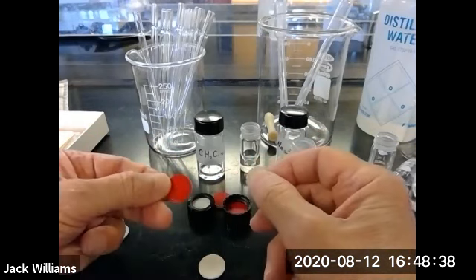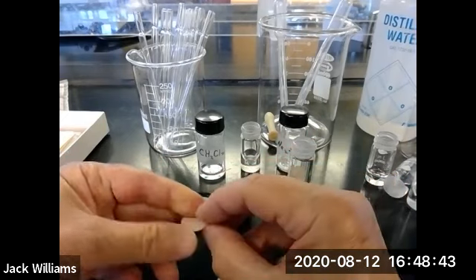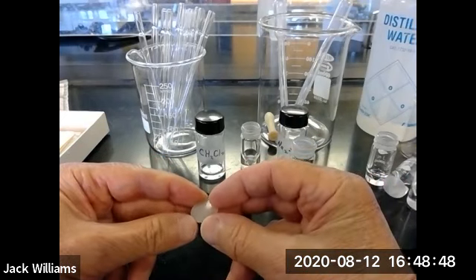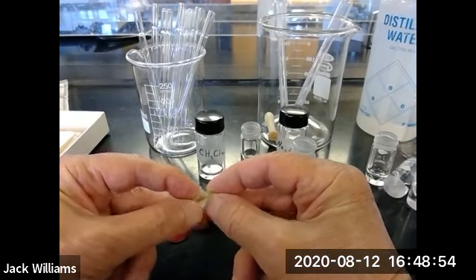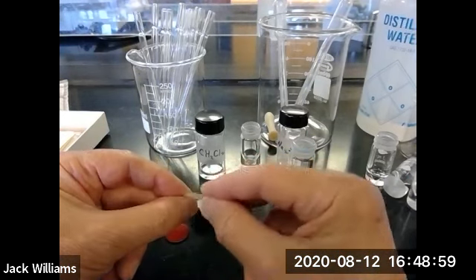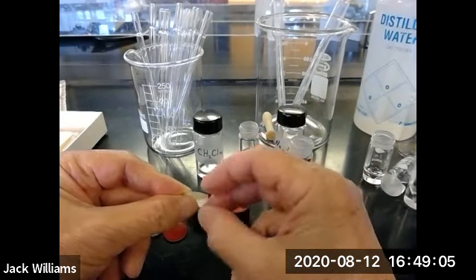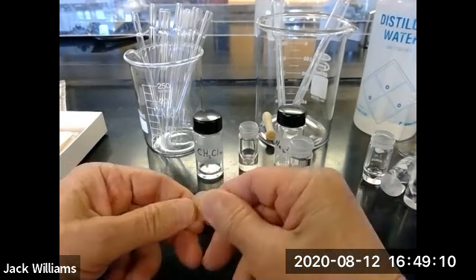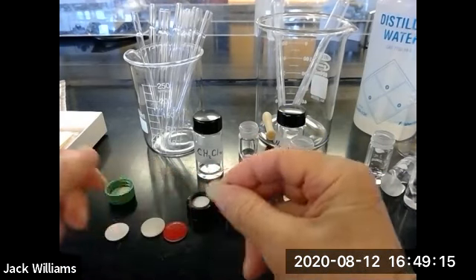Well, in this case, you say it's the dull side that faces down. Well, how about this case over here? That looks kind of dull, that looks kind of shiny. So what you have to go by is that it's the Teflon part that faces down, and that's the thinnest part. If you look at this edgewise, you're going to learn something in this experiment if you take your time. You will see a very thin top layer. That's the Teflon, because Teflon's expensive, and that's always the thinnest part of the cap. In this case, it looks like a dull side, but don't use that. Look at it and figure out which is the Teflon side.